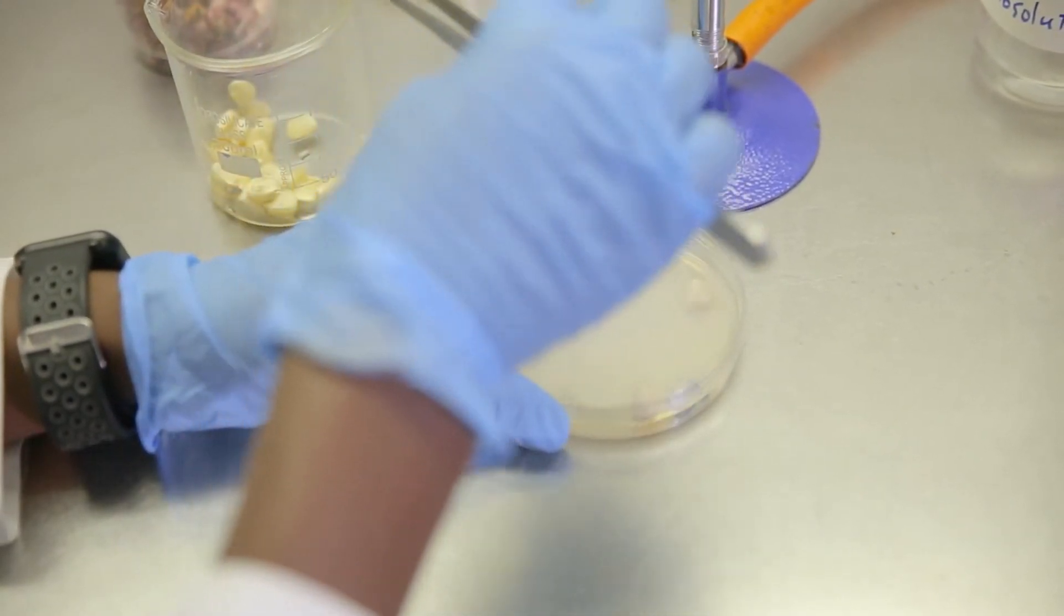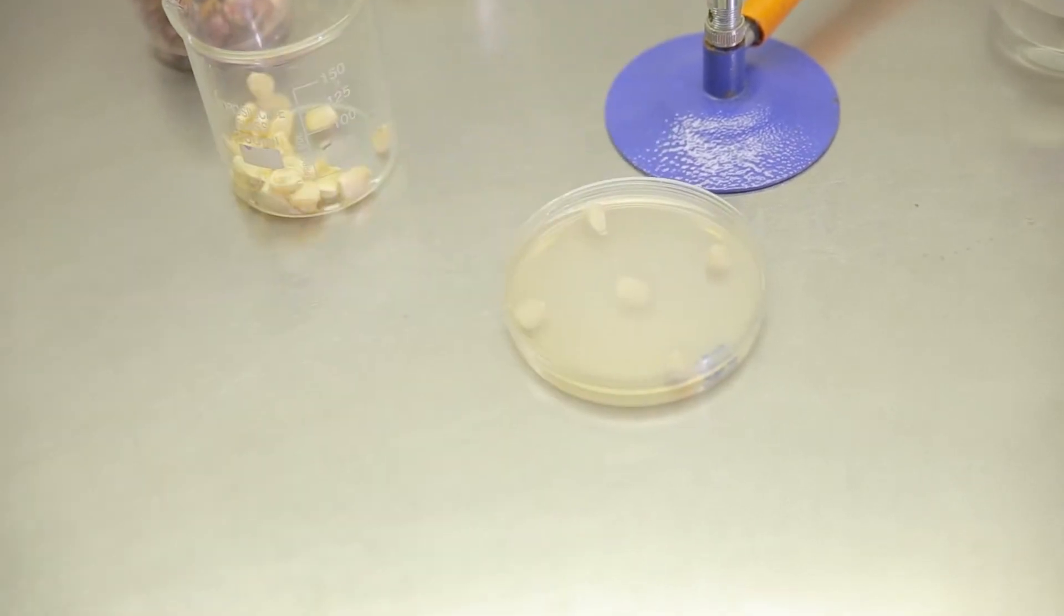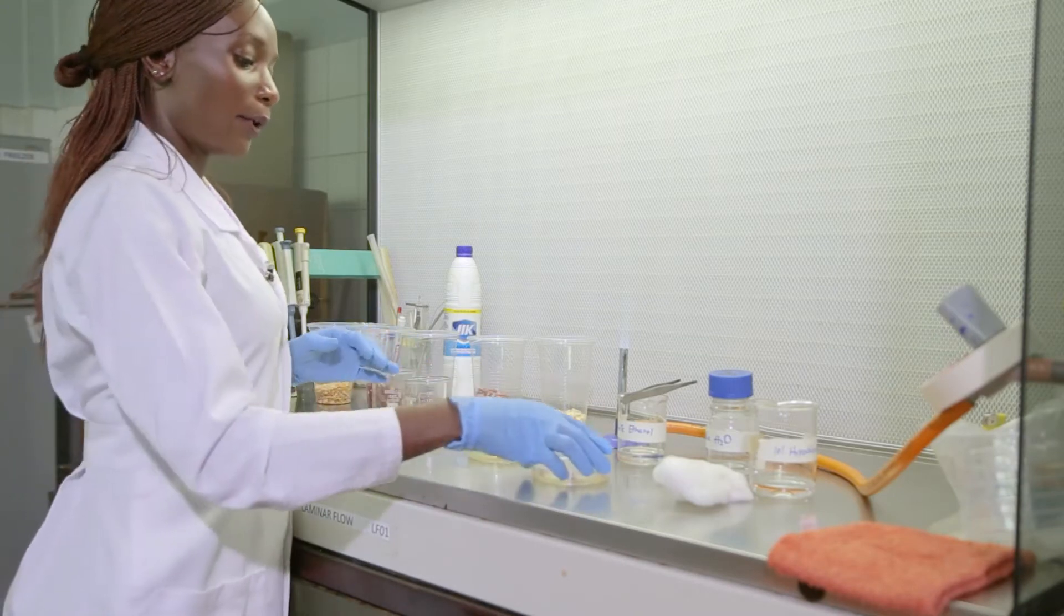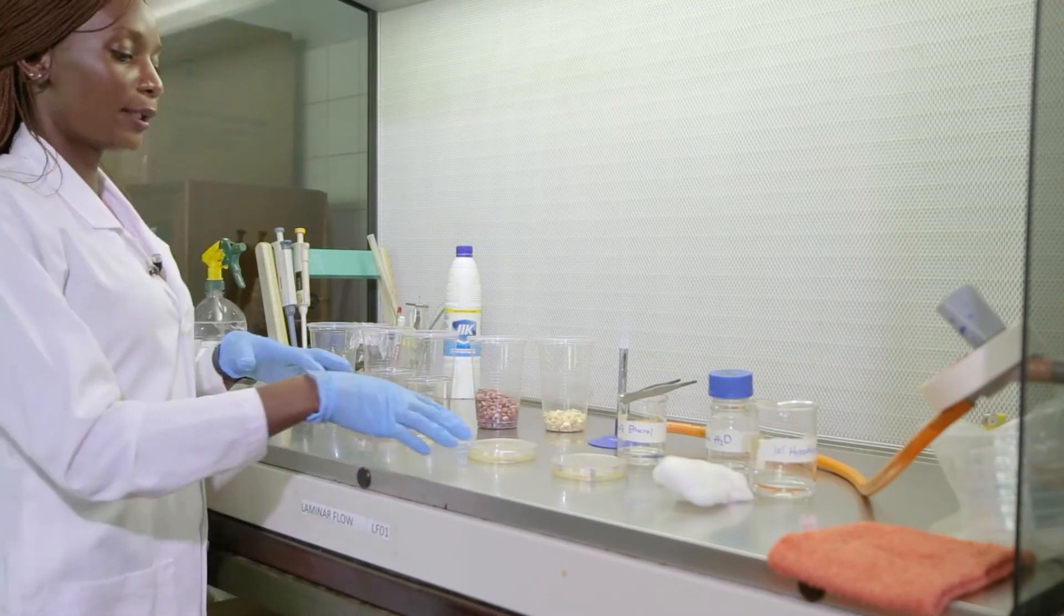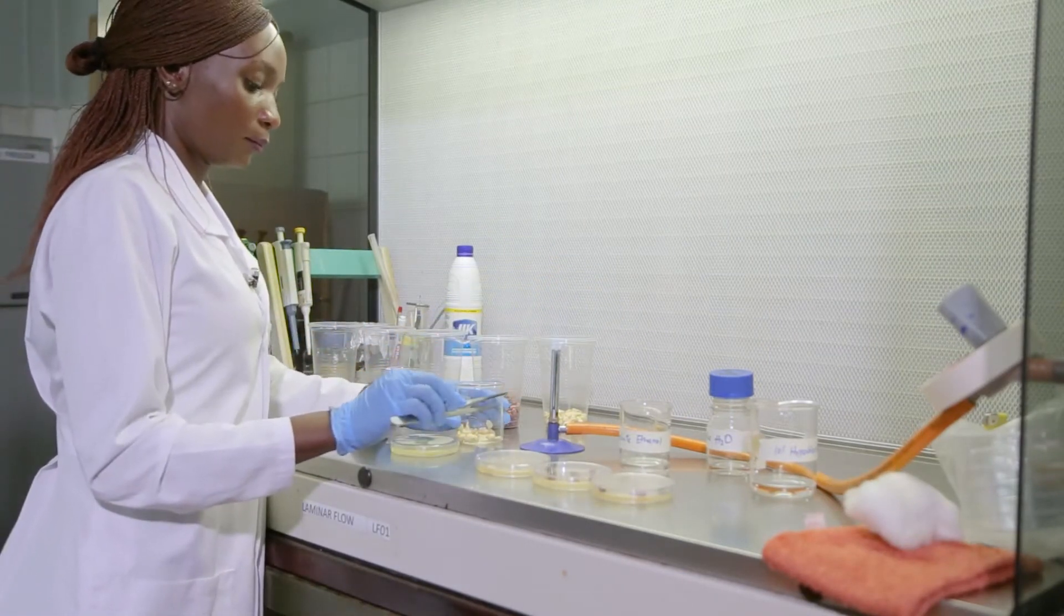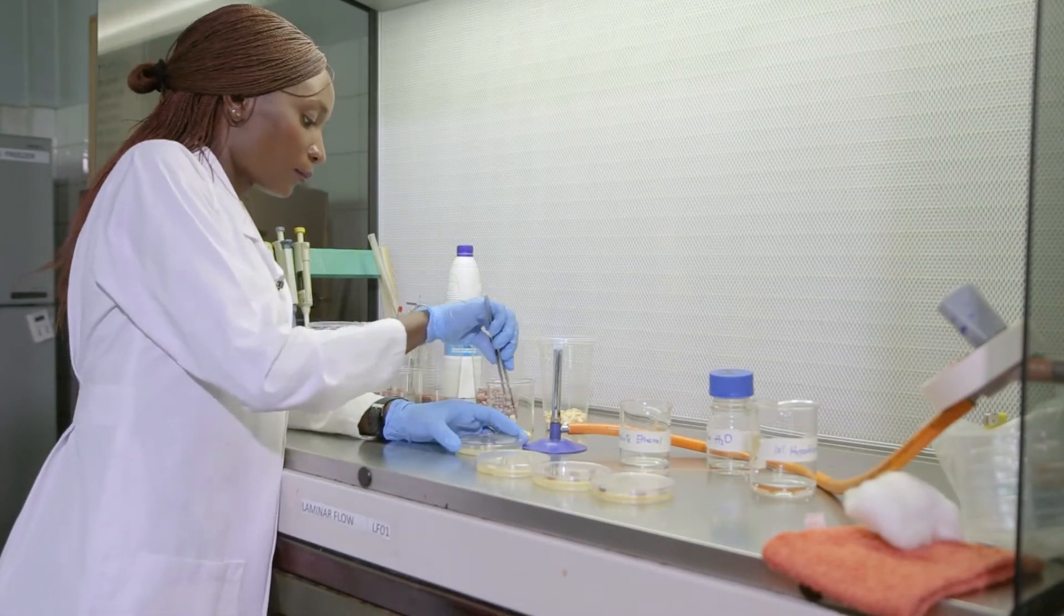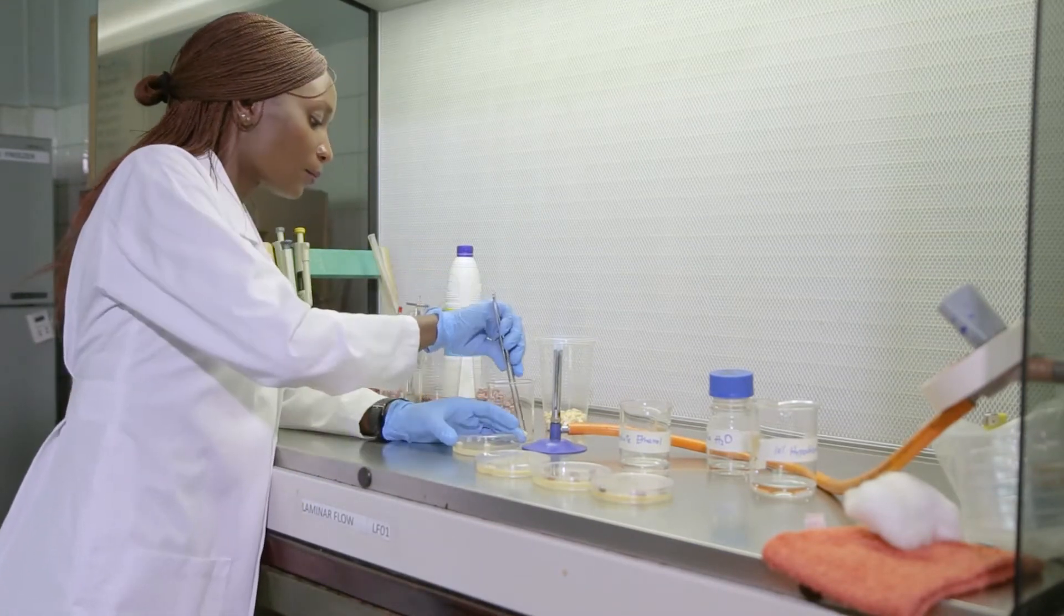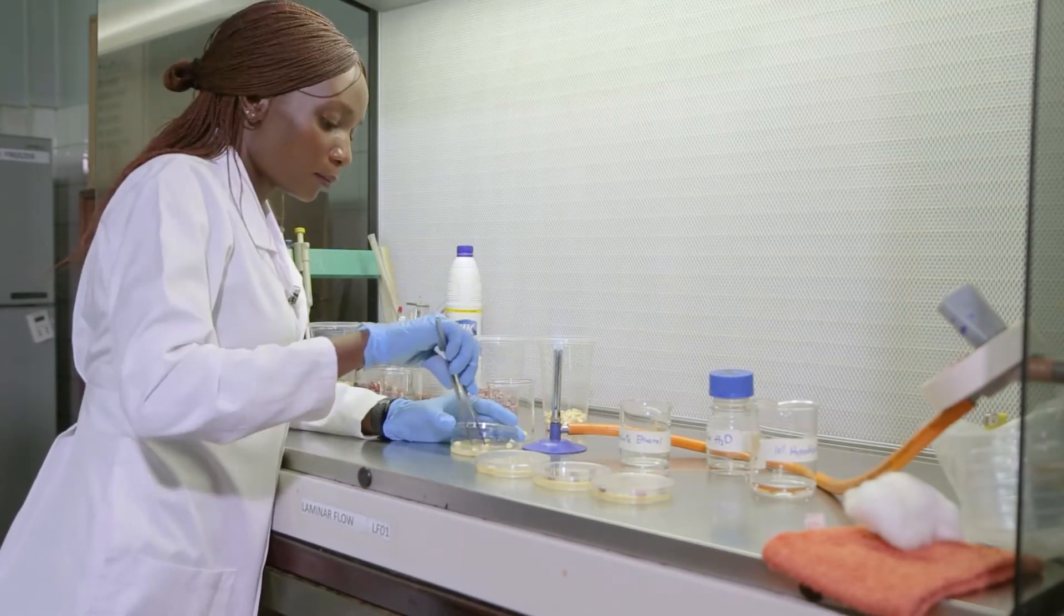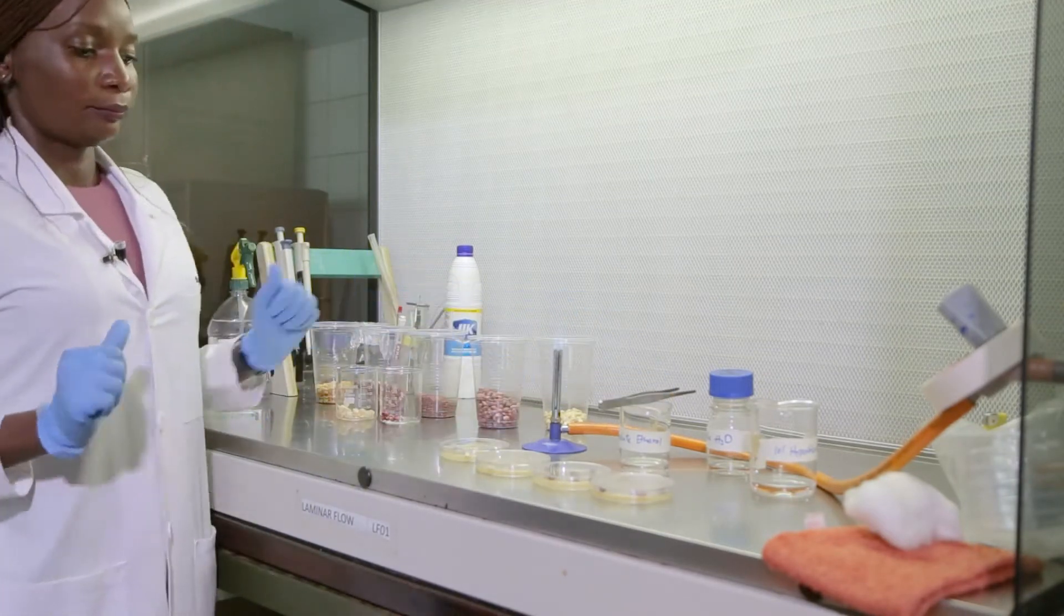So having done that, you do the same for all these grains and seeds, and then you do that in duplicate. So I'll have to do this again and also do this again. So I have two plates of each of these.